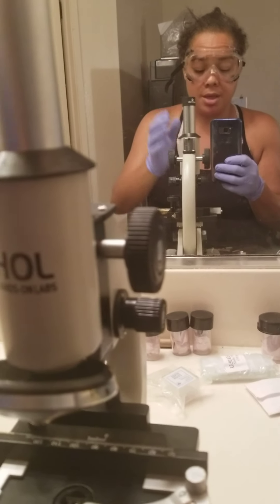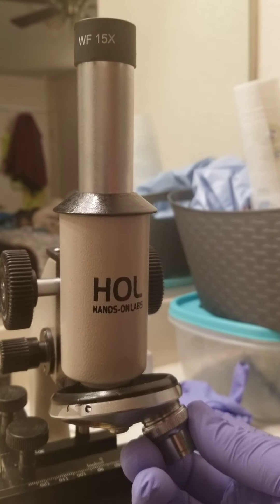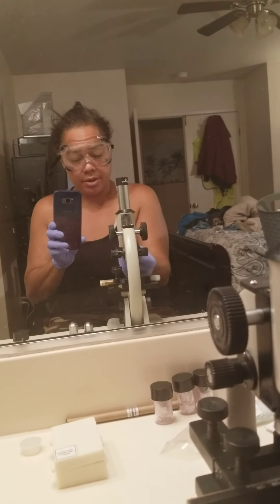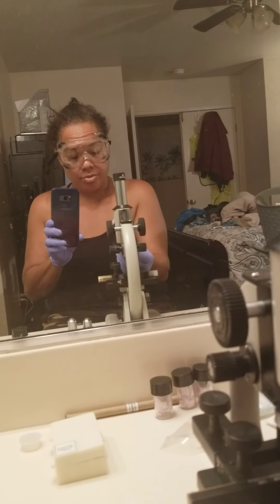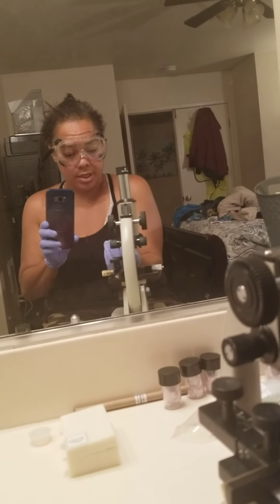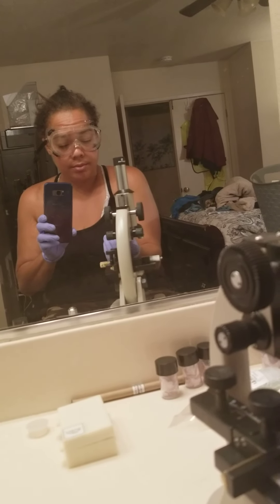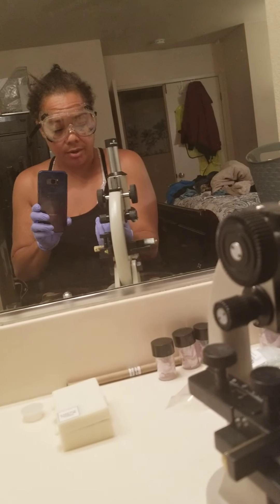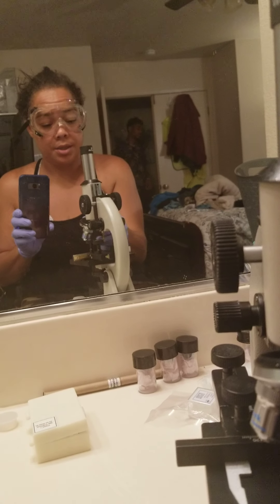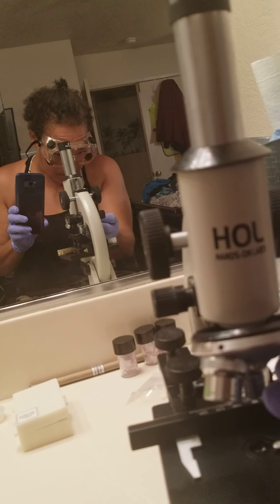I put my lens on and then I have all of my magnified lenses. I think doing this in front of a mirror makes it so that I can actually show myself. So I'm going to put on my lenses. Understand that each lens magnifies 10 times more. I'm applying my lenses and I'm going to try the yeast one more time.